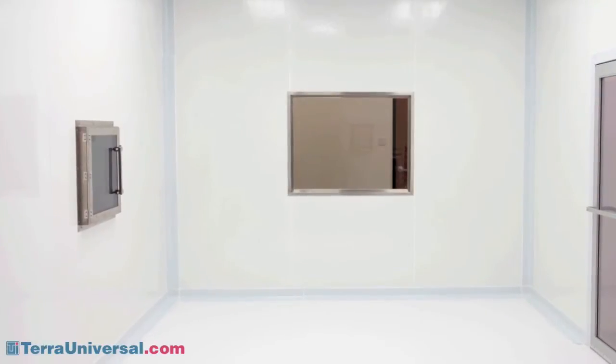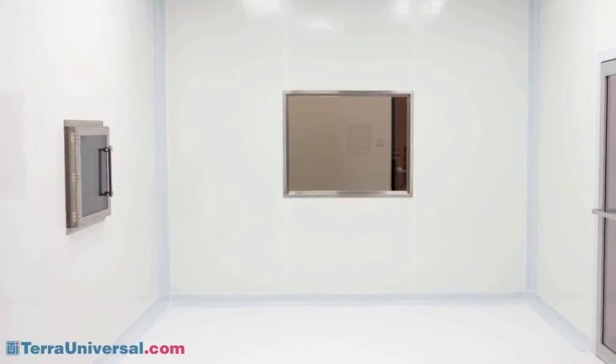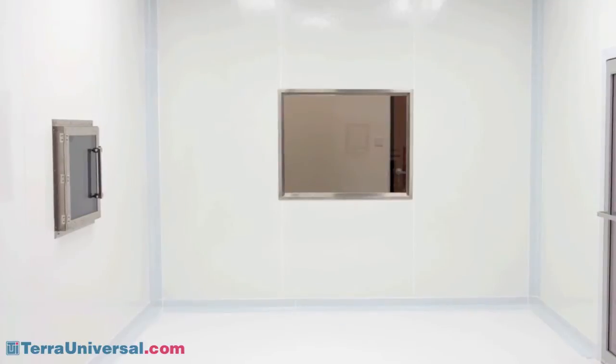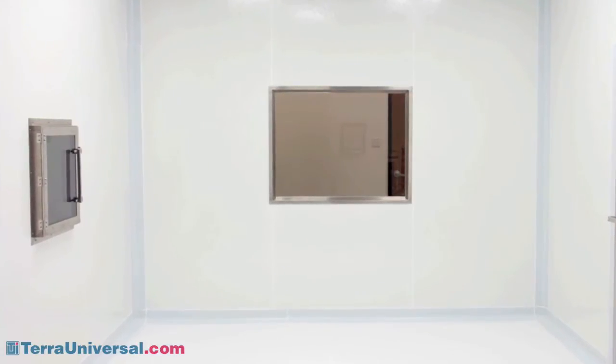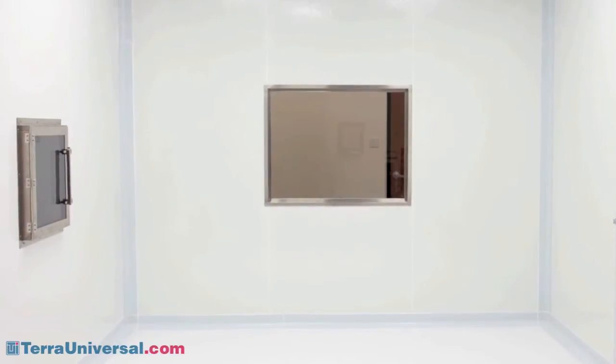In this video, we'll provide installation guidelines for fiberglass reinforced plastic panels on a modular clean room or clean room conversion. These panels are available as Class C or fire resistant Class A.